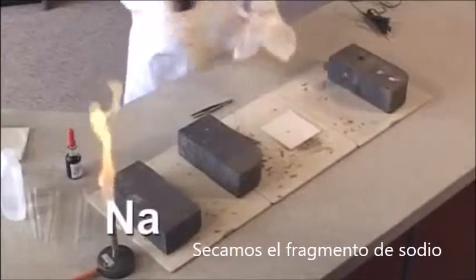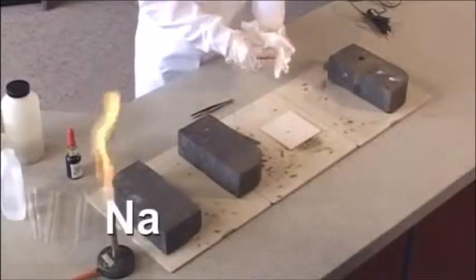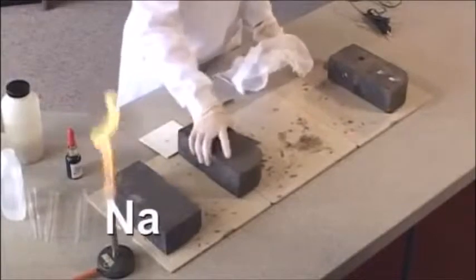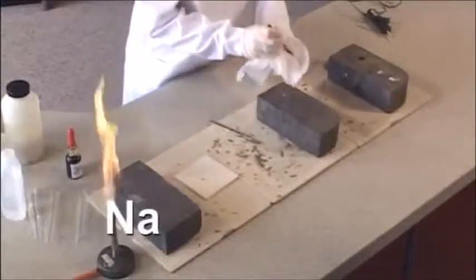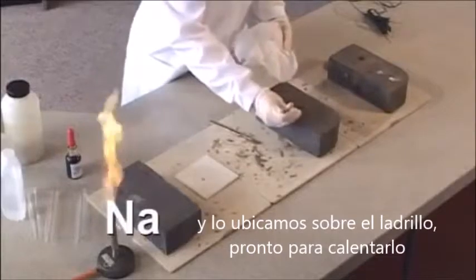Dry off a piece of the sodium. And place it on a brick ready to heat.